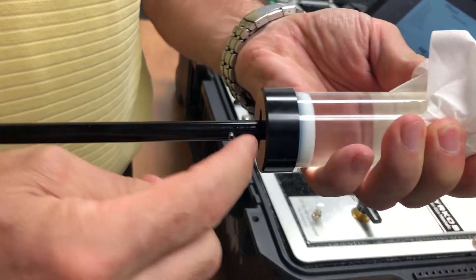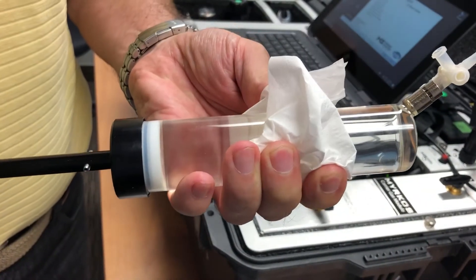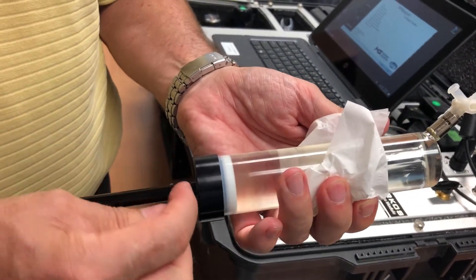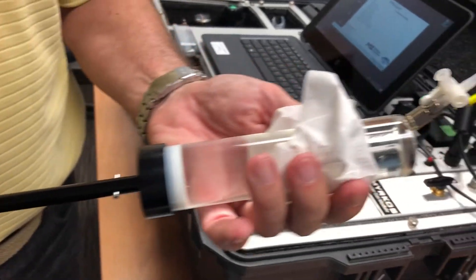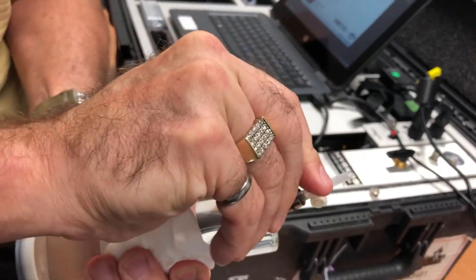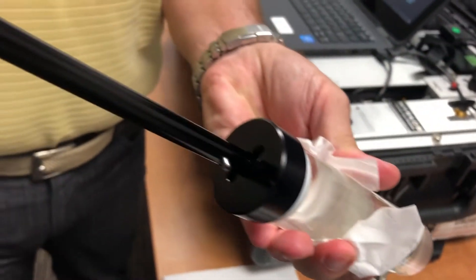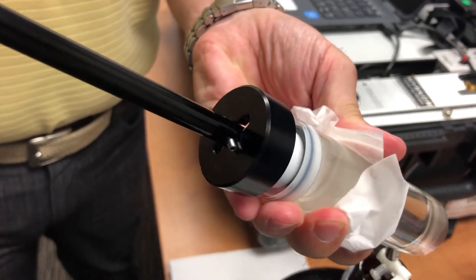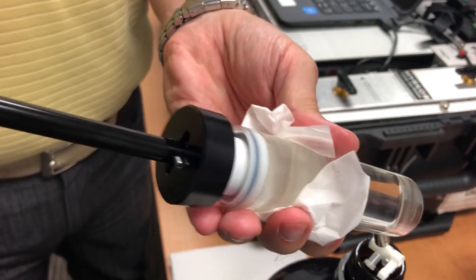What we're going to do is push out this volume of oil out of the syringe and we're going to create a headspace or an air bubble. So by doing that you always push out the proper amount of oil every time without making any mistake. So again you turn out, you open the valves and we push out exactly that volume of oil. And as you can see here you cannot go further. There's no chance of any error measurement of how much oil has to be pushed out.